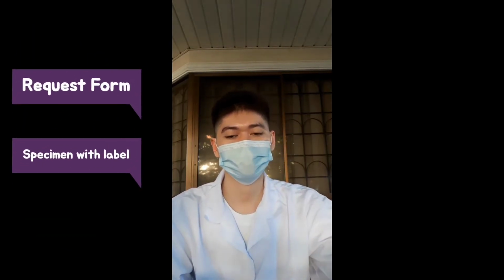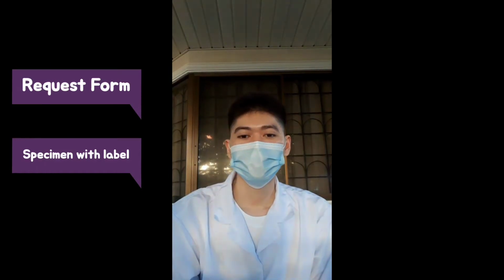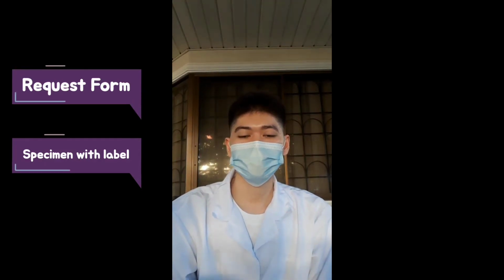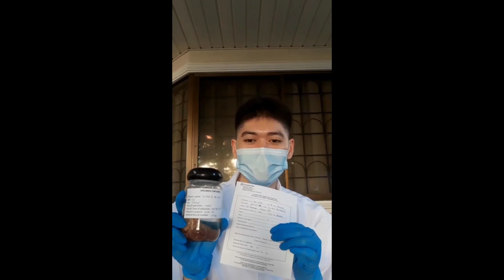So the two important things that we need to receive in the laboratory are, of course, first the request form, and the second is the specimen container with a specimen that is prefixed with formalin. So the next thing to do is to check if the information given on the request form matches the information that is also indicated in our specimen container.